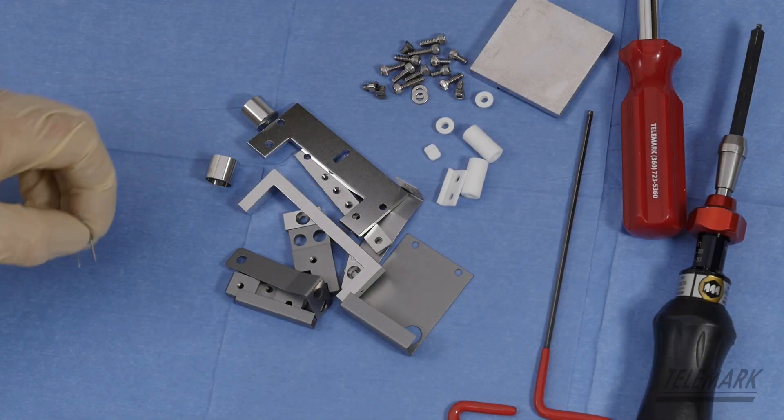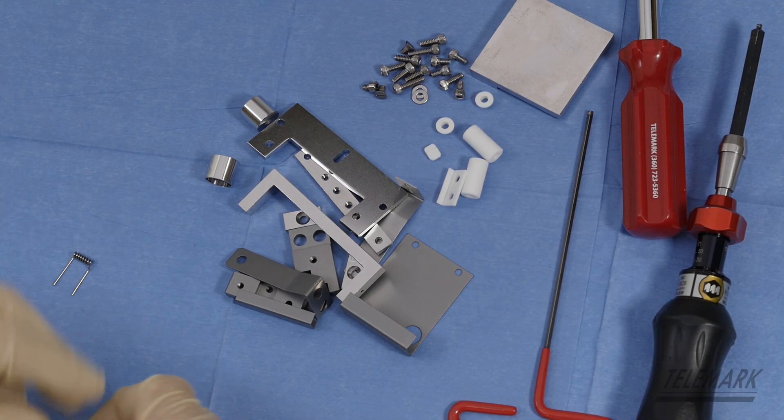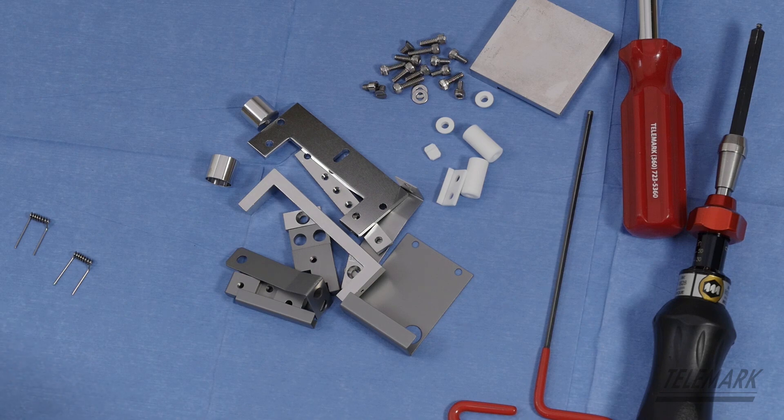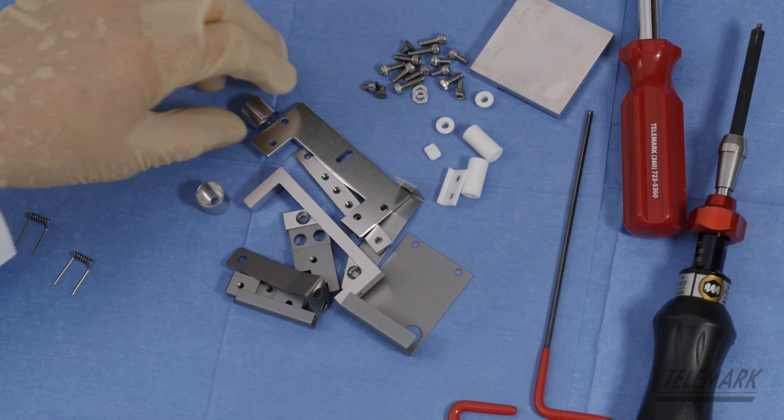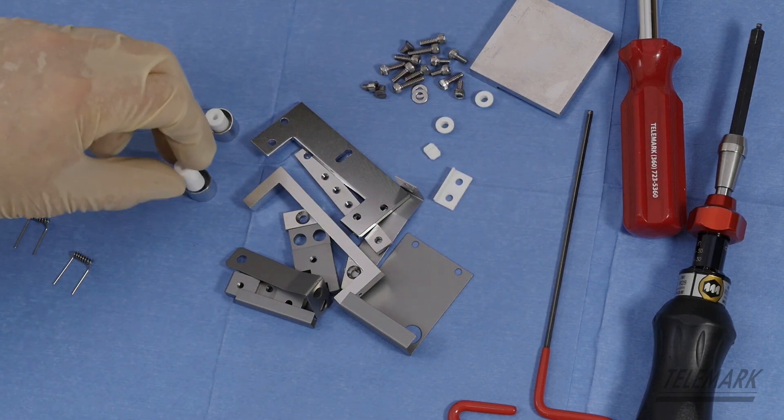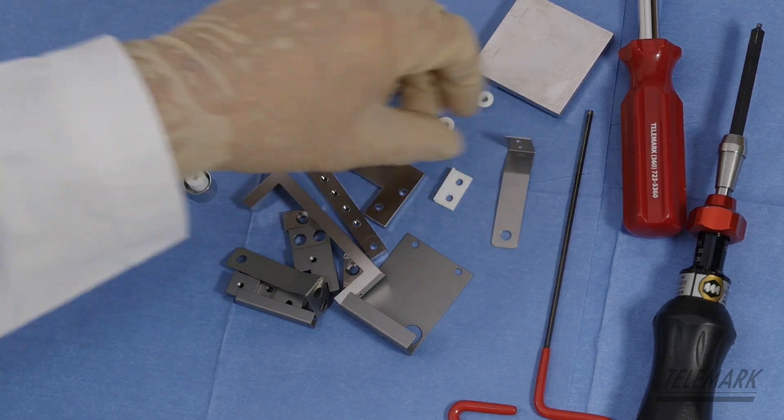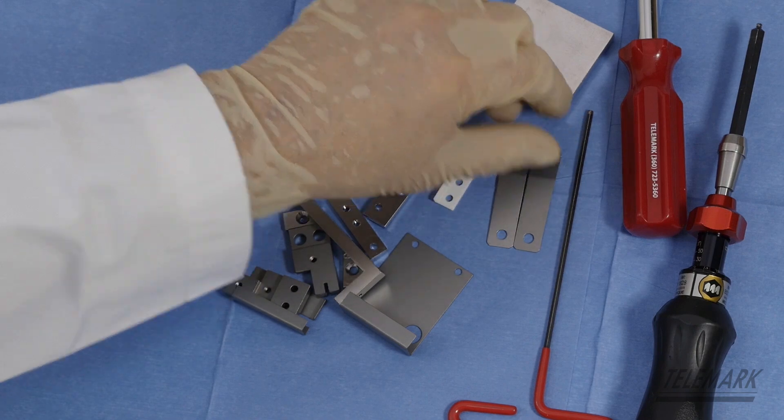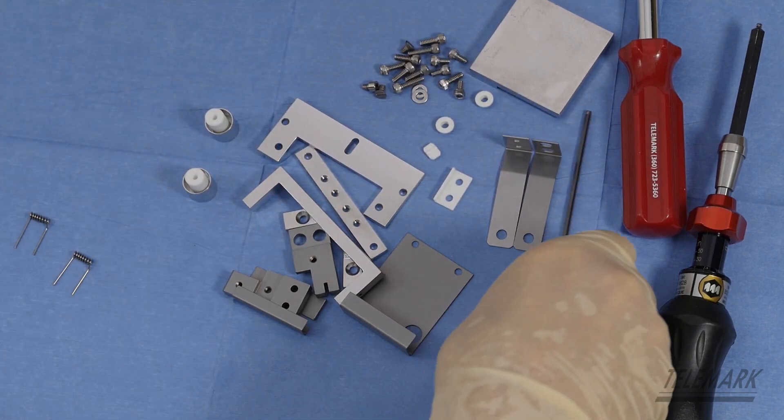And this is a Telemark 273-0150-8 emitter. I'm going to start out by sub-assembling some components. That's to clear some of the stuff out of your path.